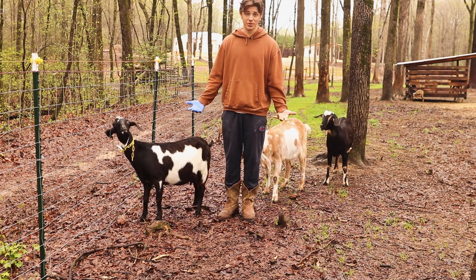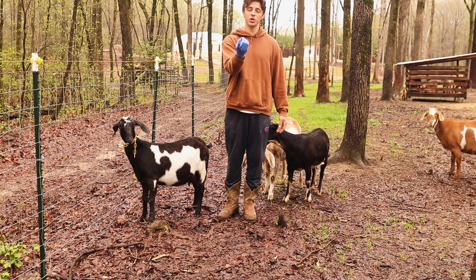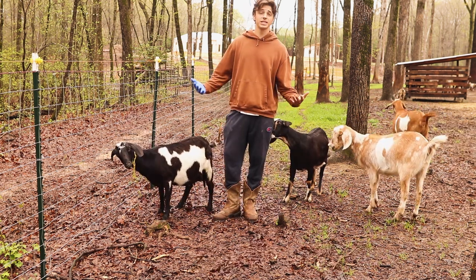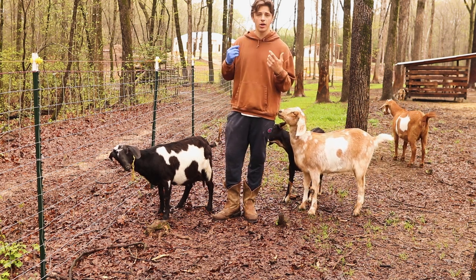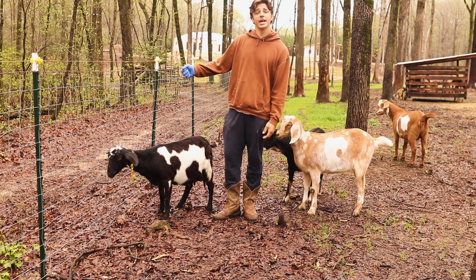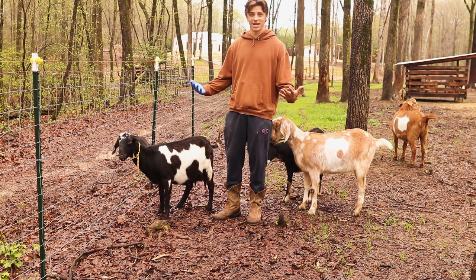First step, we have to actually get the poop. Whenever you're doing this you want to wear rubber gloves. You're going to go inside the goat's backside and then scoop your finger up a little bit, and you'll feel a little pocket where all the poop is stored. If I'm ever doing stuff with goats by myself, we use plastic breakaway collars on all of our goats. I take a carabiner, hook it on that collar, and then hook it to the fence — that way they're restrained with just one person.